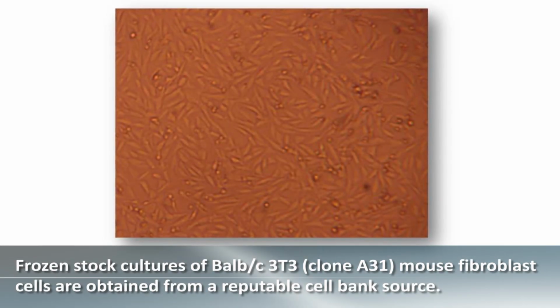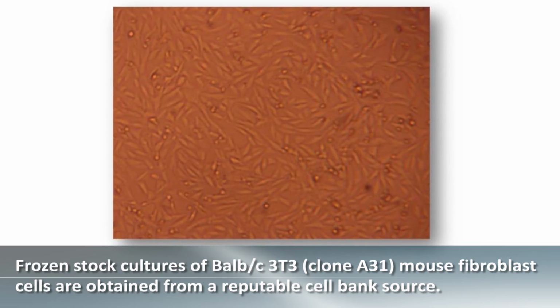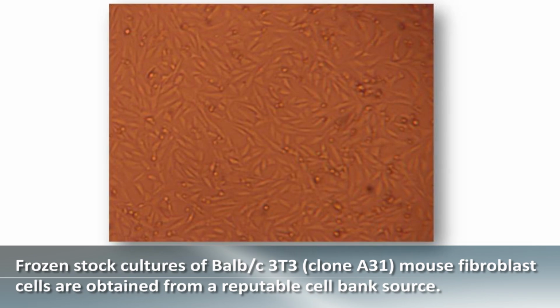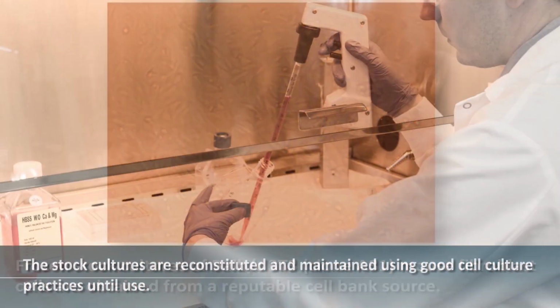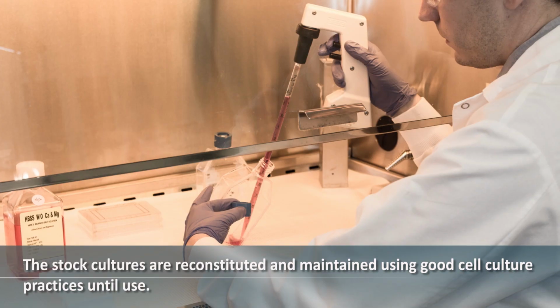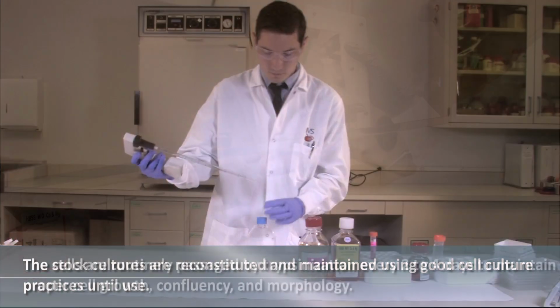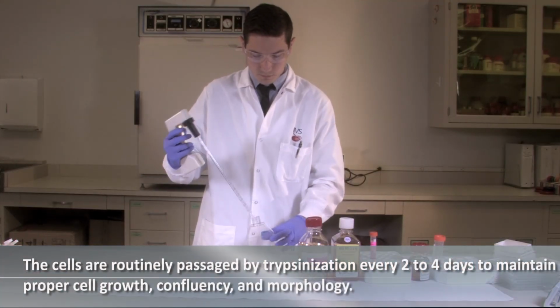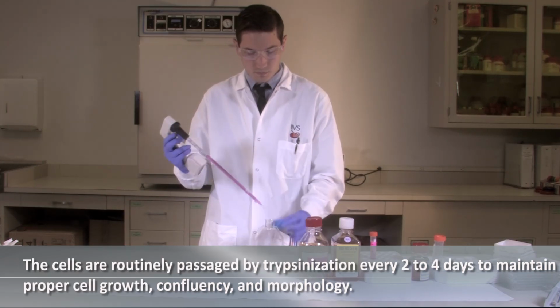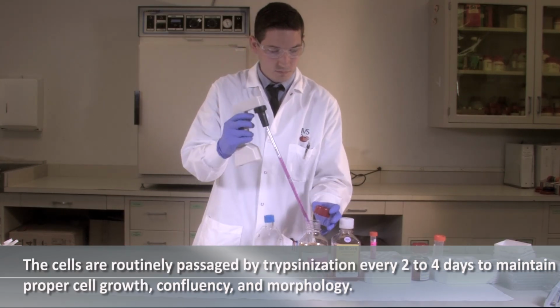Frozen stock cultures of BALB/c 3T3, clone A31, mouse fibroblast cells are obtained from a reputable cell bank source. The stock cultures are reconstituted and maintained using good cell culture practices until use. The cells are routinely passaged by trypsinization every 2 to 4 days to maintain proper cell growth, confluency, and morphology.